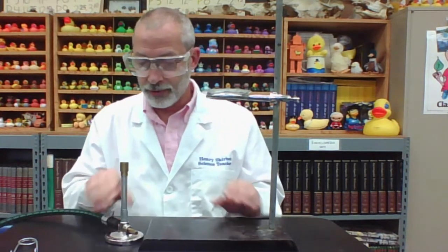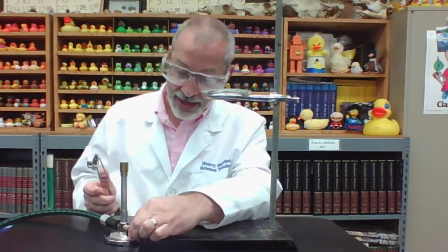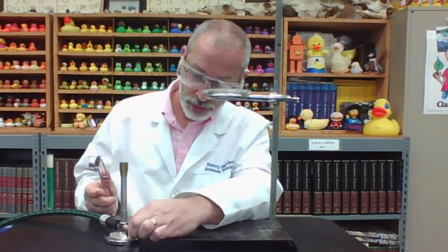So I'm going to remove the burner right now, and I have already familiarized myself with the unit. Now I'm checking the system to make sure the tubes are tight, the jet and valve are closed, and the collar is closed. Now, system on. I'm opening the gas jet, getting my striker ready, opening the valve, and I'm going to light the burner.